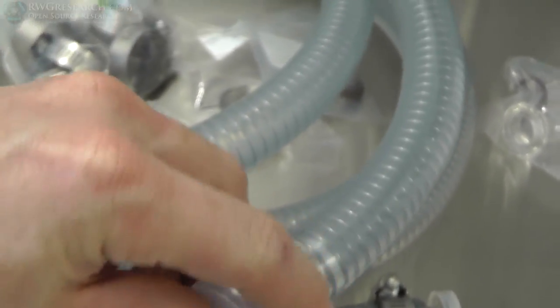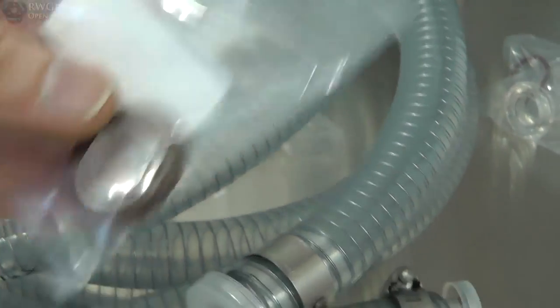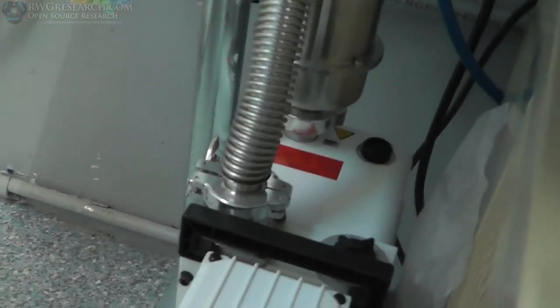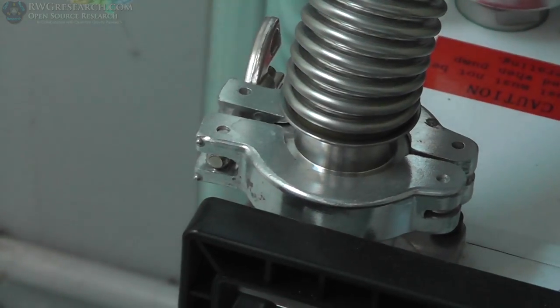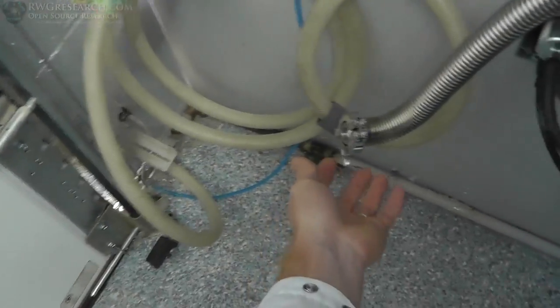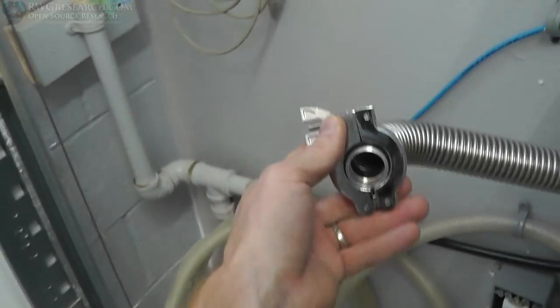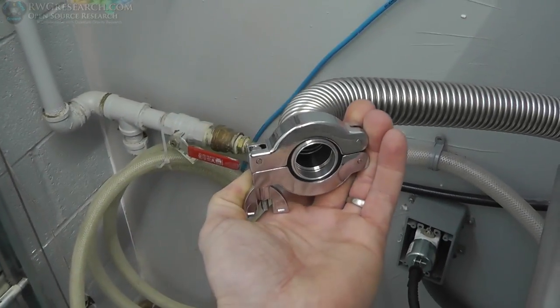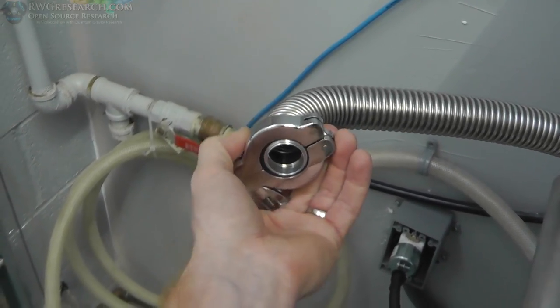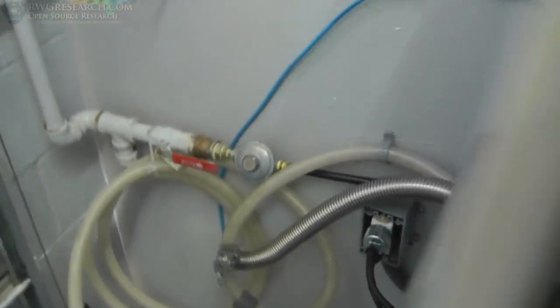And these have these clamps and seals. So the seal goes in here, clamp goes on the outside. I'll show you what it looks like on the vacuum line. So it basically looks like that. And then on the back side of this pipe, it's hard to get to. All right, I'm gonna make it so we can attach it right here. And then this also is for this oven, so we wanna make it dual purpose. So when we get to it, I'll show you how it goes. This side actually needs to be attached to this glass with a clamp.